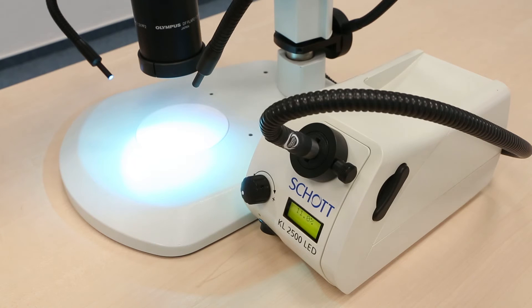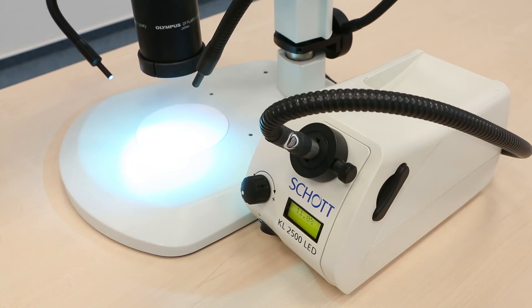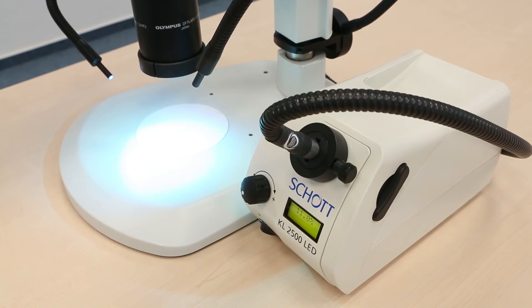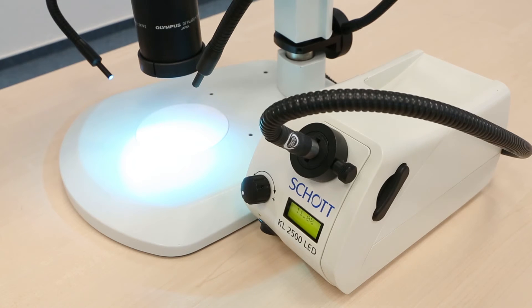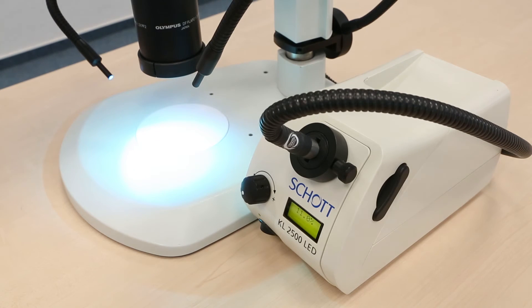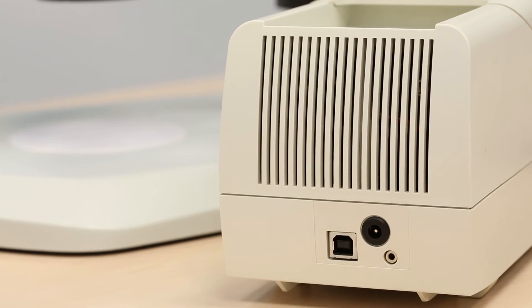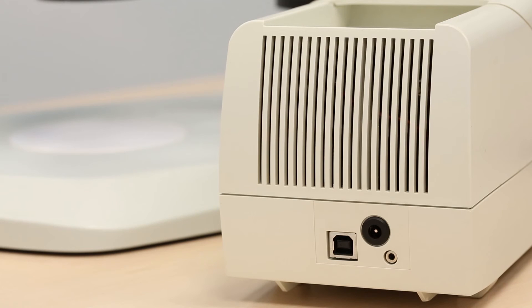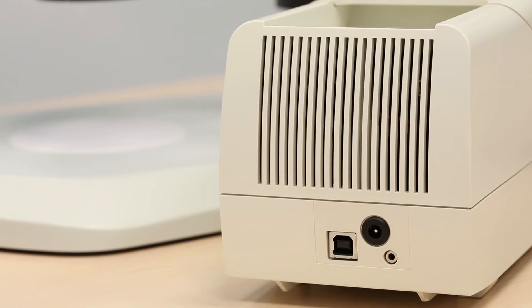Schott has many other colors also available. Should you be interested in any of the colors please feel free to visit our website or contact your local support. This light source also enables you to work with a remote control or a foot switch.